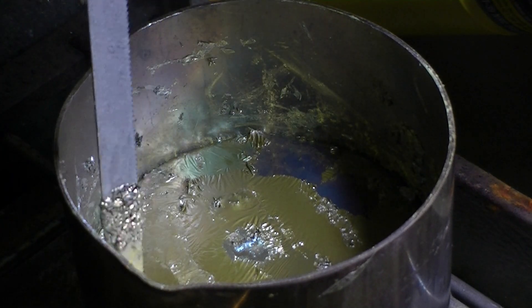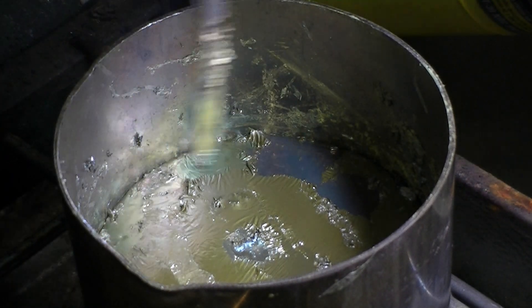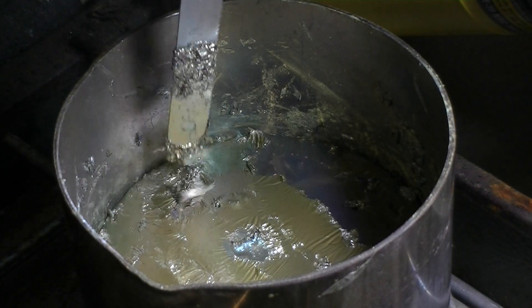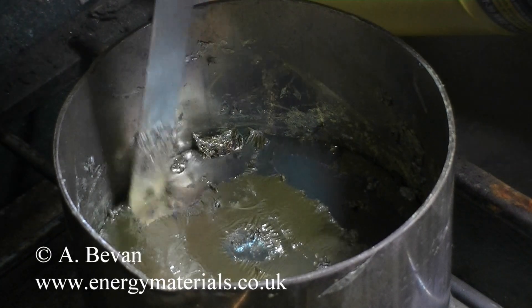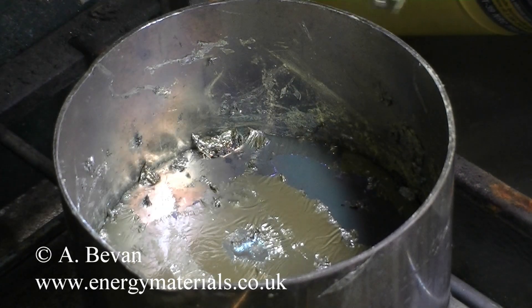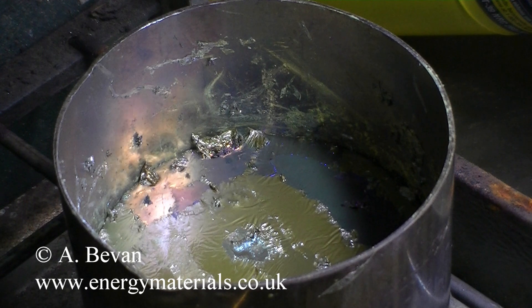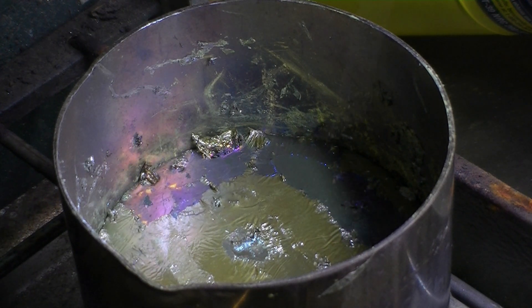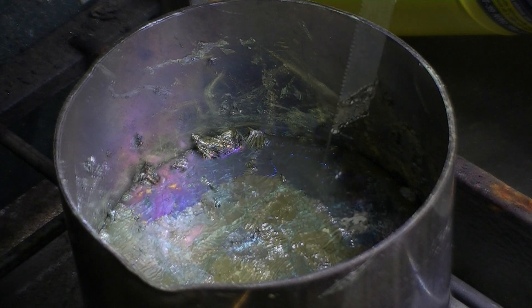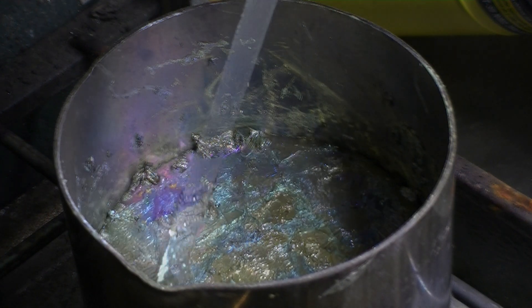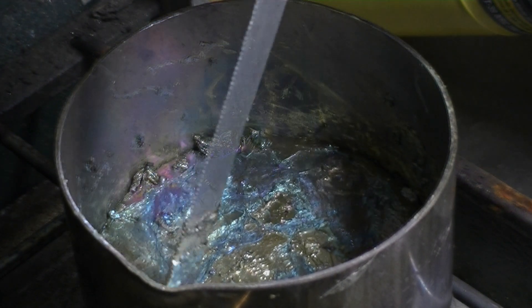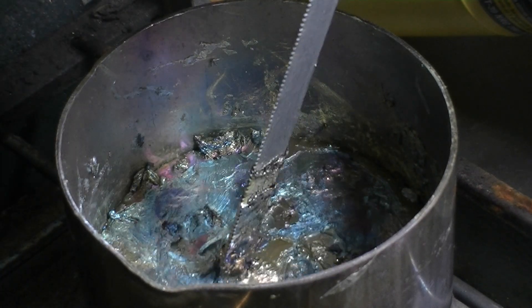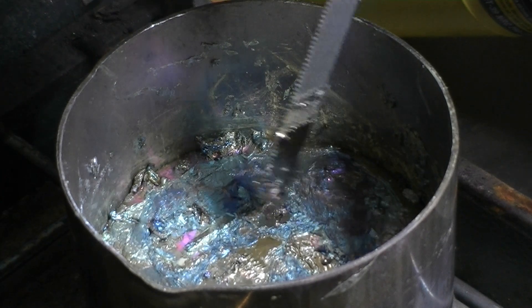With the heat turned off, the liquid bismuth metal slowly begins to solidify. We are trying to grow crystals from the top down. What we want is the crystals to grow in the center but not to solidify and attach to the sides of the container as this would make removing the crystal very difficult. A hacksaw blade is being used to test for solidification.